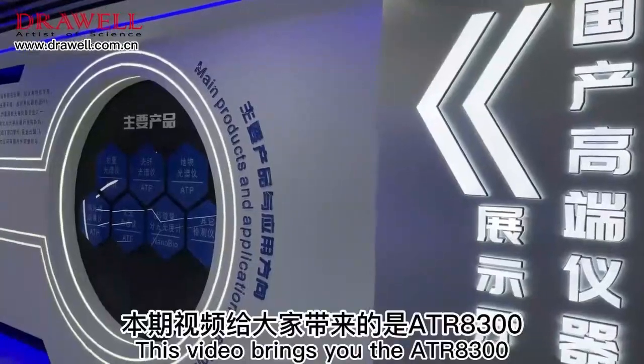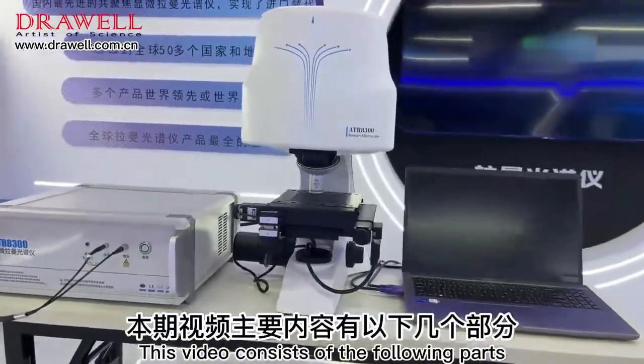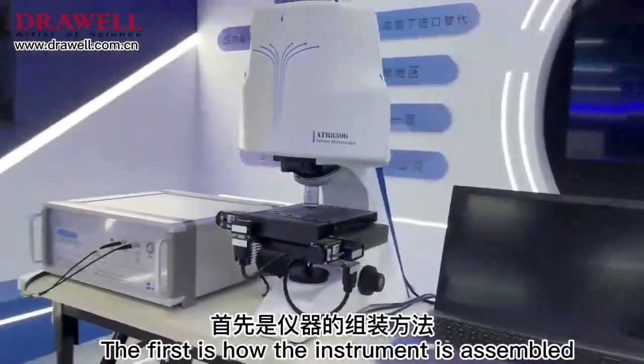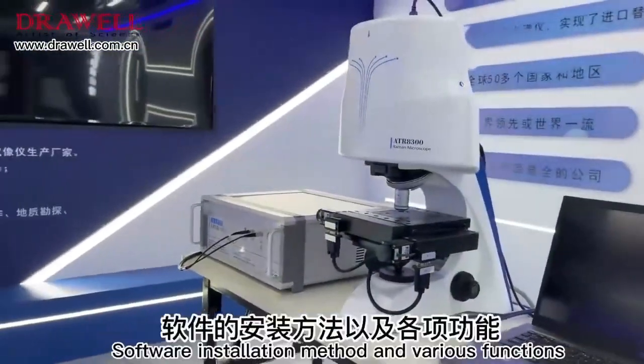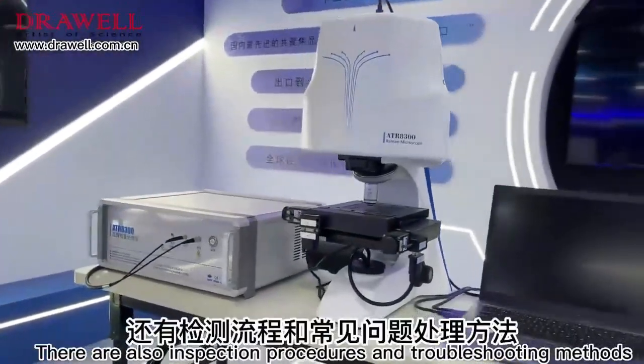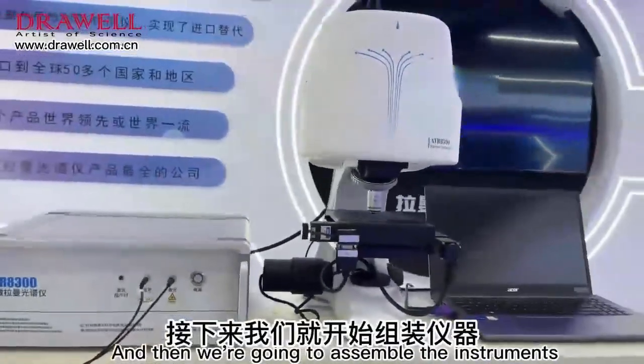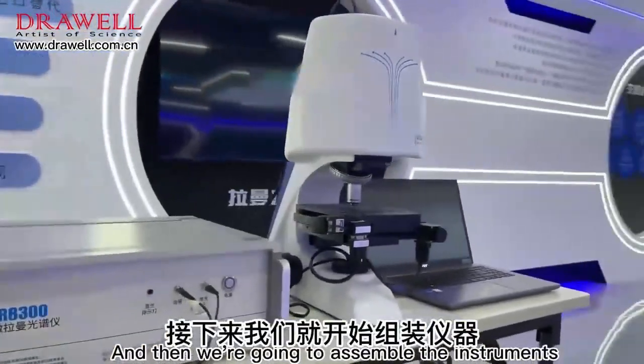This video brings you the ATR8300. This video consists of the following parts. The first is how the instrument is assembled, software installation method and various functions. There are also inspection procedures and troubleshooting methods. And then we are going to assemble the instruments.